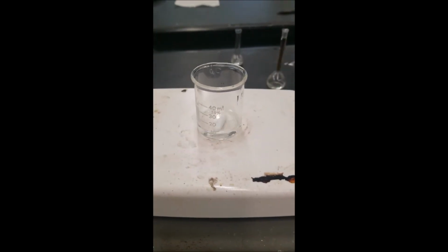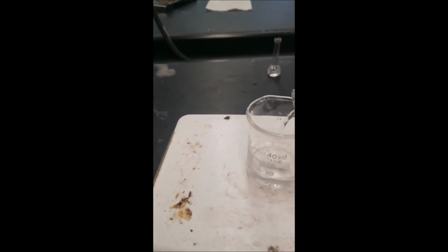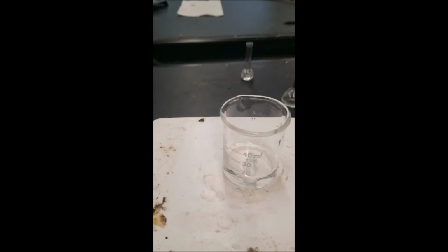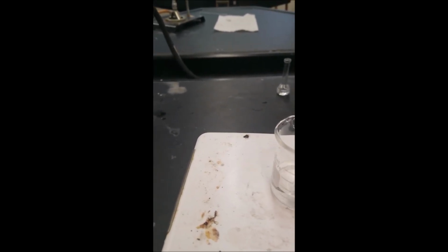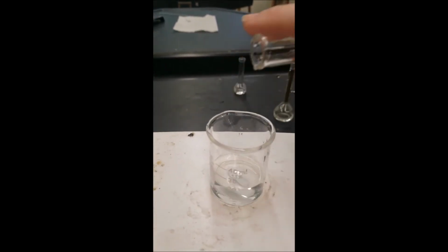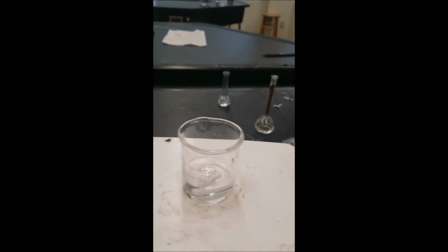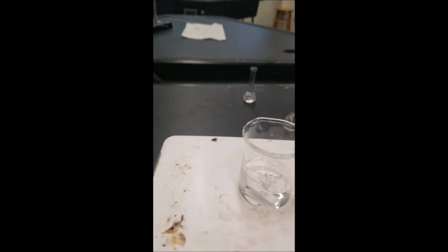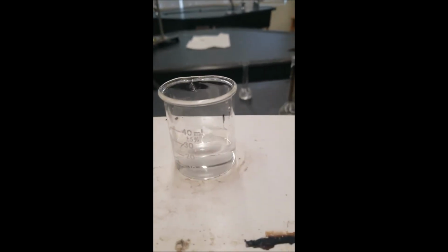This solution will simply be lacking the manganese. It will contain the malonic acid instead. Now our peroxide. So, no manganese, or very little manganese, assuming I didn't screw this up.